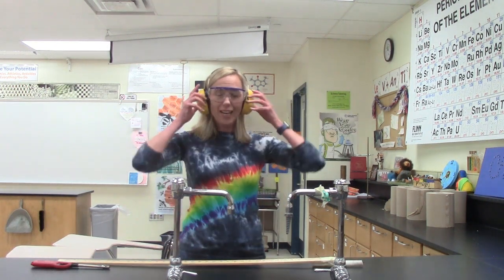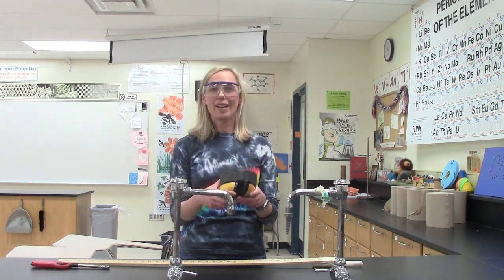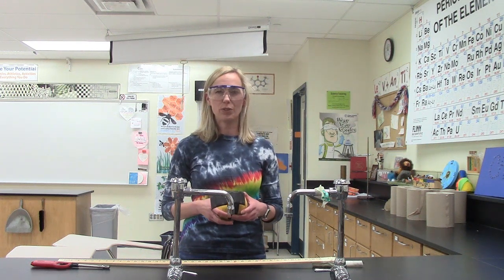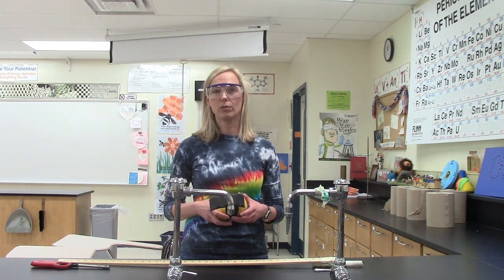How about that for a chemical reaction? As for me, I'm glad I was wearing my earmuffs so that did not hurt my ears. Hopefully you enjoyed that synthesis chemical reaction.